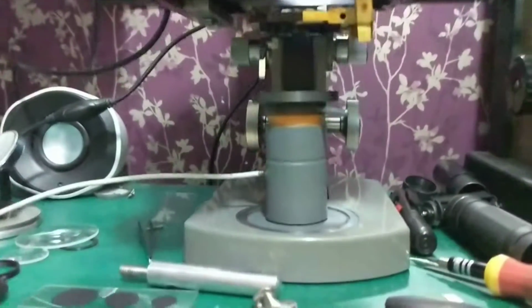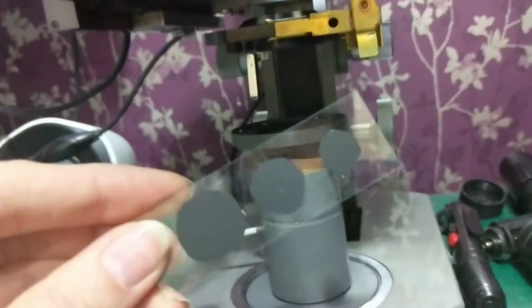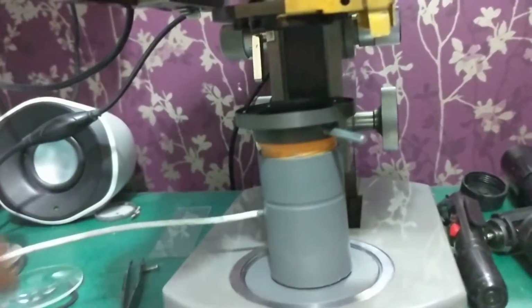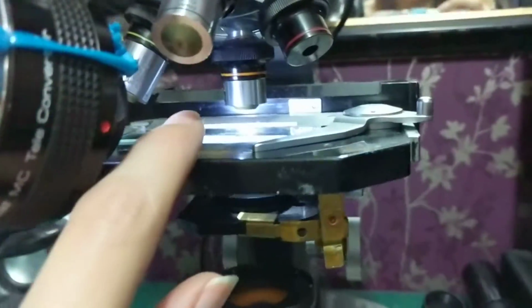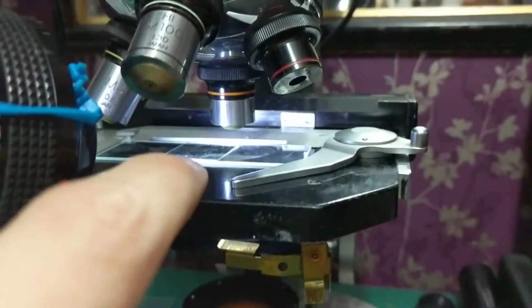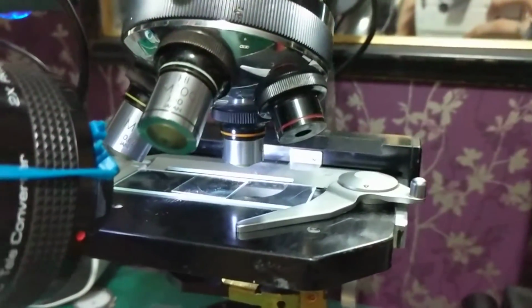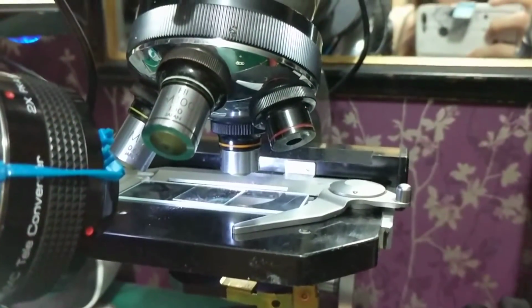And basically what that is, we'll have the light source here, and then there'll be these occultation discs, which I created, between the light source and the Abbe condenser. And I've just got to create a little bit of a holder for that. And the condenser will go above sort of here-ish. And that'll refocus the light onto the slide. And then there should be a disc of darkness in the middle with the illuminated bit on the slide. And yeah, anyway, it's a little bit complicated for me to explain because I'm rubbish at that kind of stuff. But hopefully that'll be a more elegant solution to darkfield microscopy.